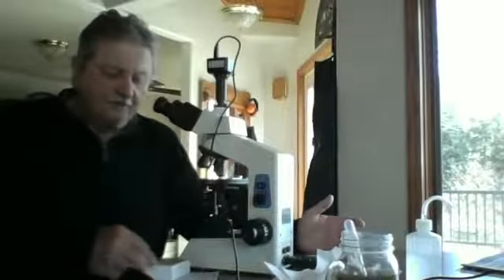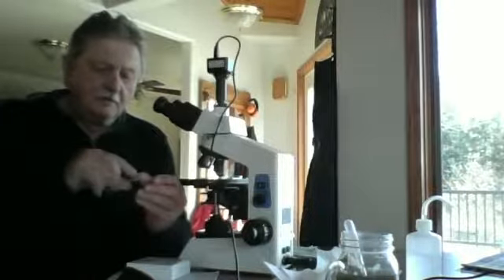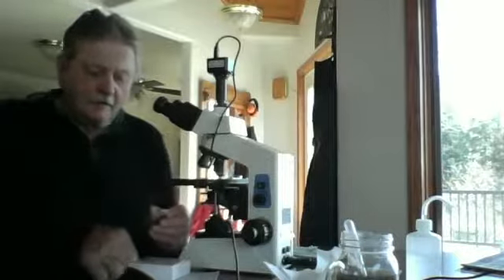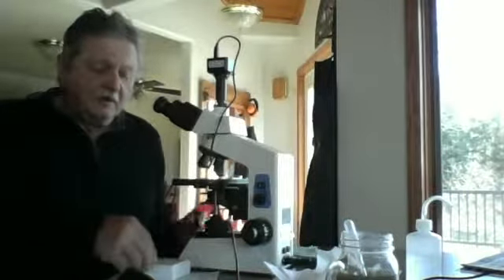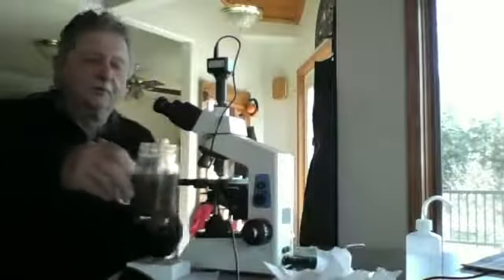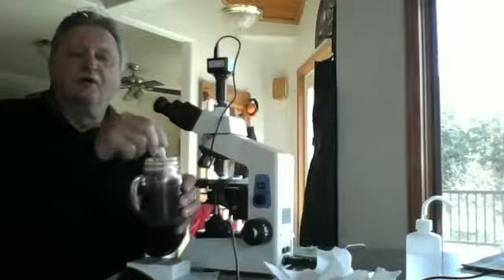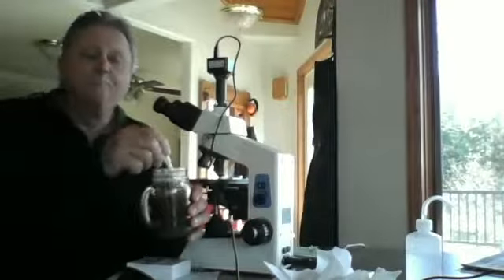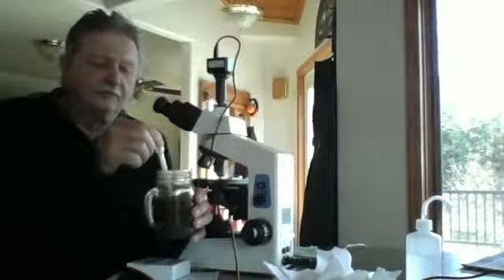So I have my slide and cover slip right here. And I have a sample of compost tea. It's been taking me a while. I've had to get my compost tea machine working. It's a small scale one, doing 20 gallons at a time. And I have a 500-gallon brewer, 2,000 liter one in the field.